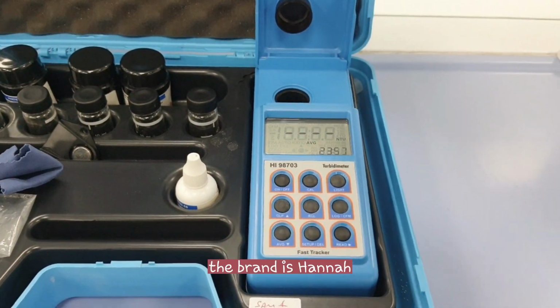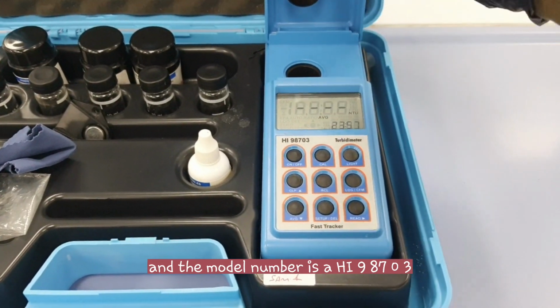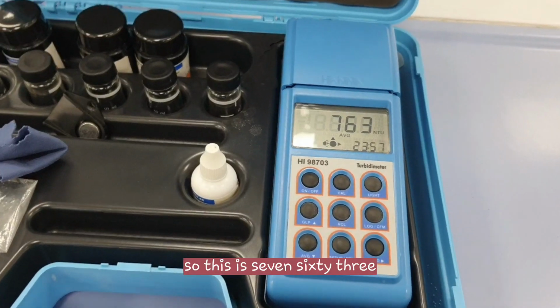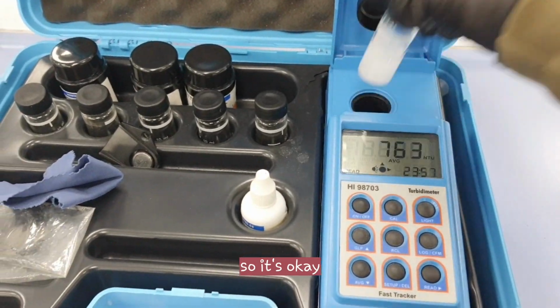The brand is Hanna and the model number is HI98703. Then we will read. This reads 763 and the printed value is 750, so it's okay.